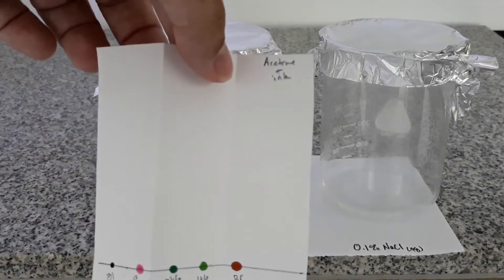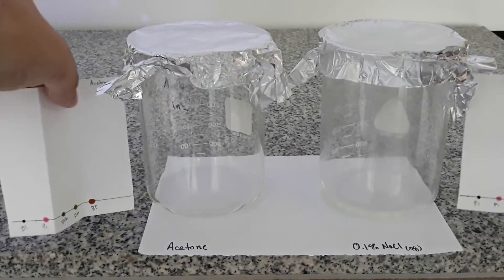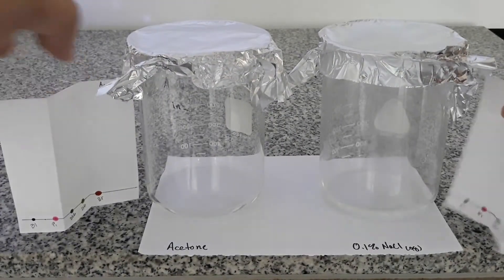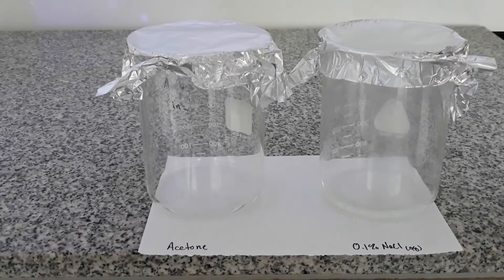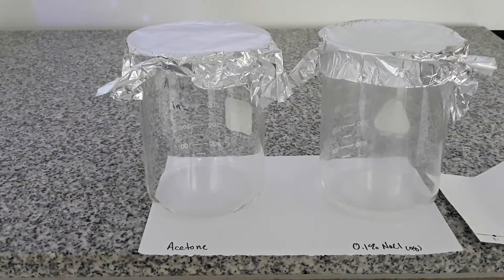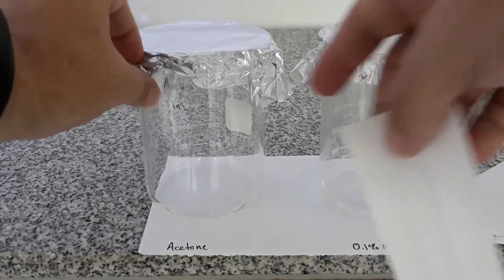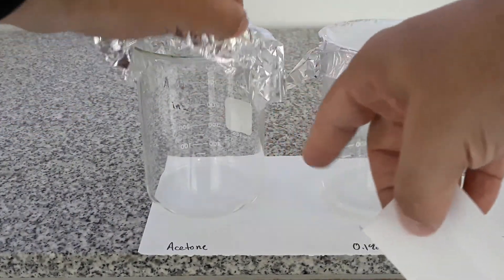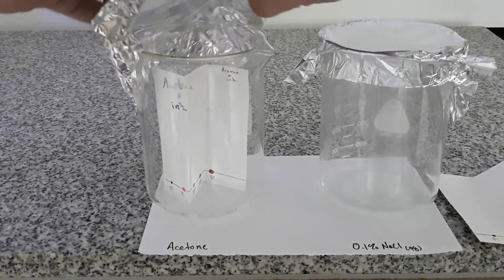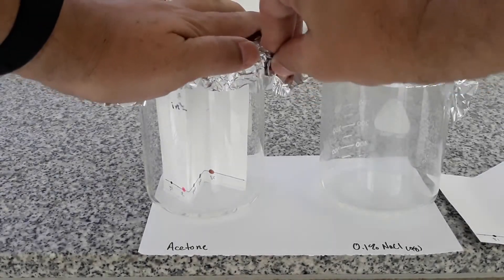So here's my first page. There's the second one. They are identical and the same colors are in the same order. It's time to put these in so I'm just going to lift the foil a little bit and drop each page into the correct chamber and then seal them back up. Make sure the page stands nice and tall.